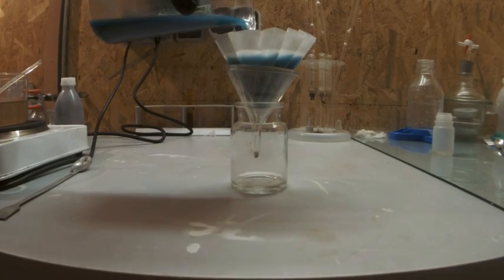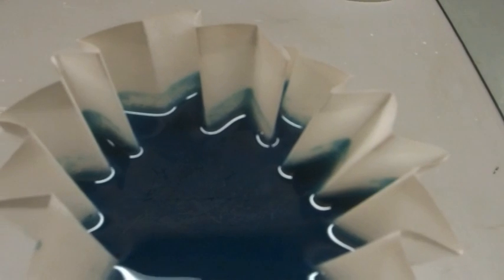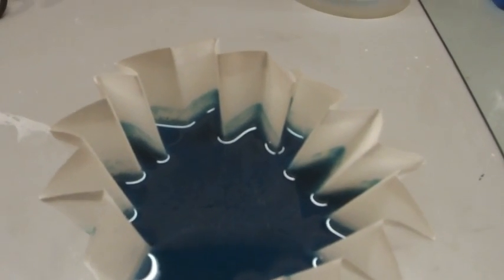After some time everything has reacted and you just need to filter the copper hydroxide off. You can clearly see the nice blue color of the product.